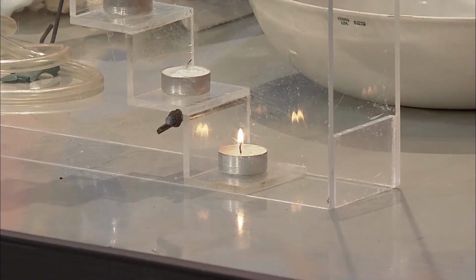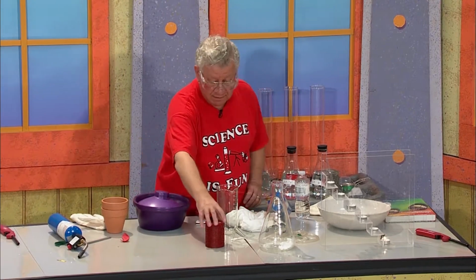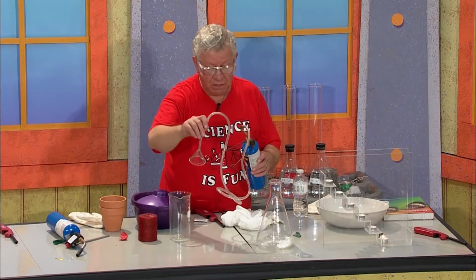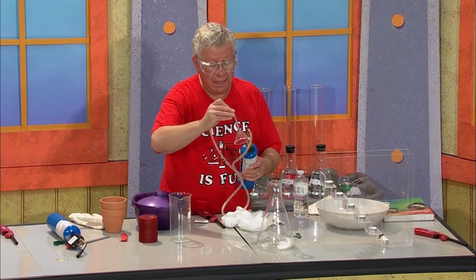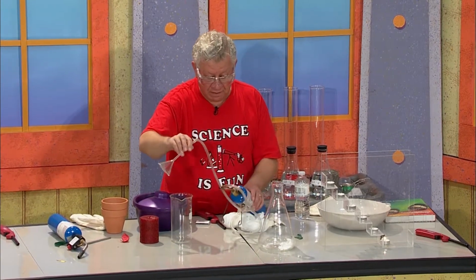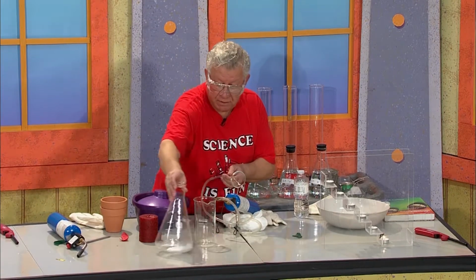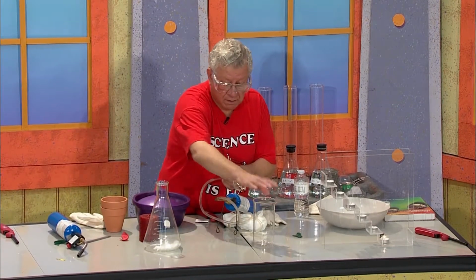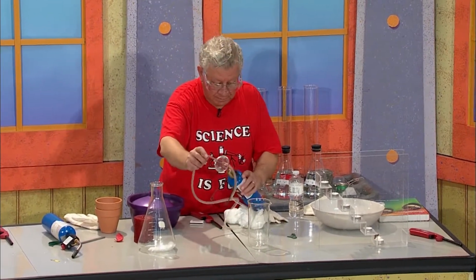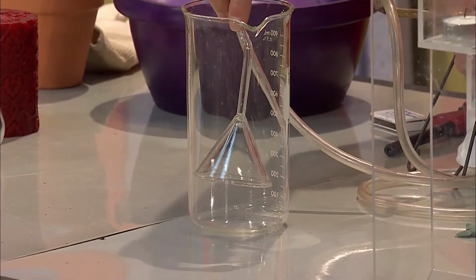and then use another gas that is denser than air. This gas is propane. It's in this propane bottle right here. It's connected to a funnel and some Tygon tubing to the valve of the propane tank. So what I'm going to do is fill this beaker with propane gas. Propane is colorless, so we can't see it. So I'm going to do this by opening the valve, and you'll hear the sound of the gas flowing. Here we go.